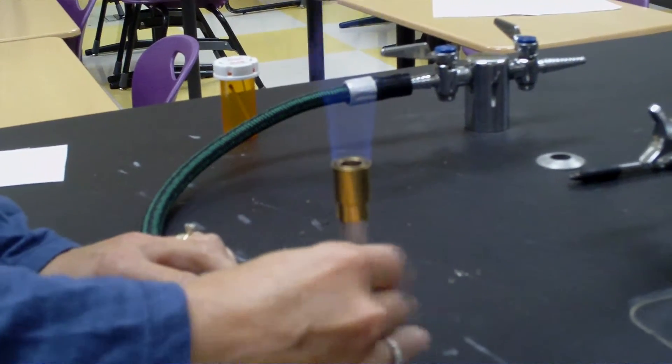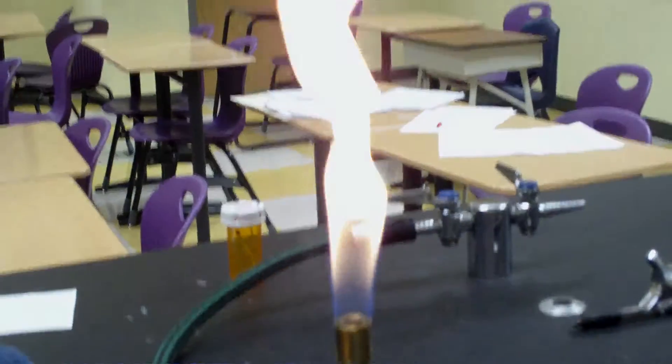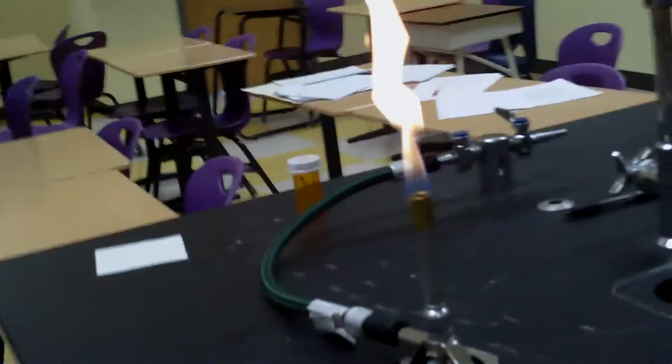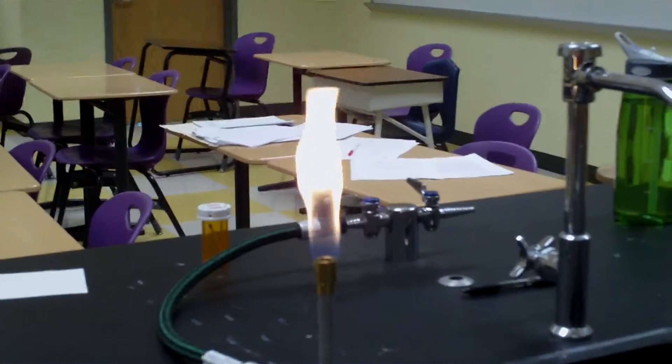I crank down the air vent, and you see an orange flame. Should we do it? Yes.